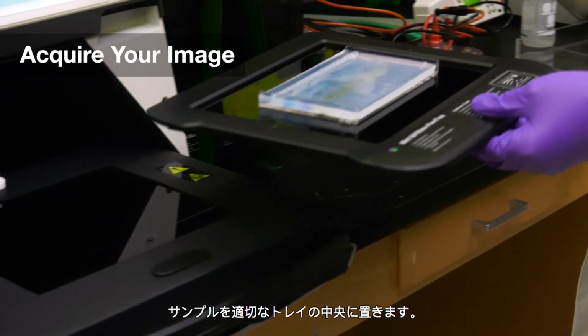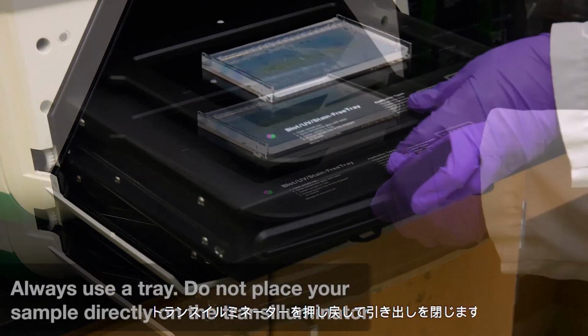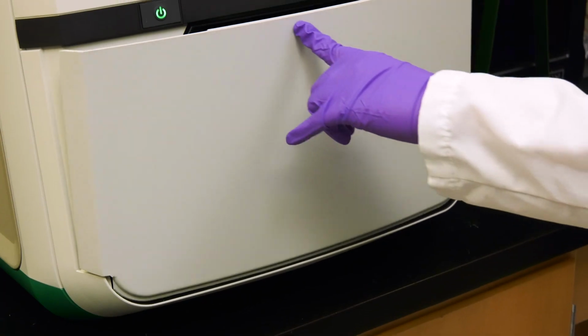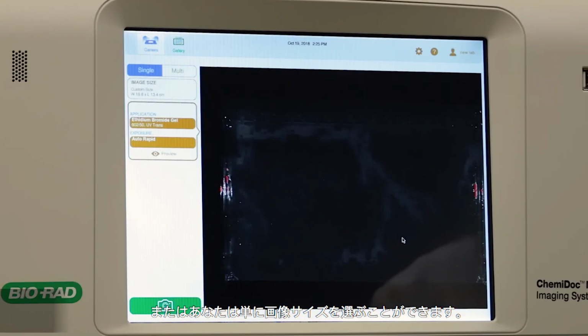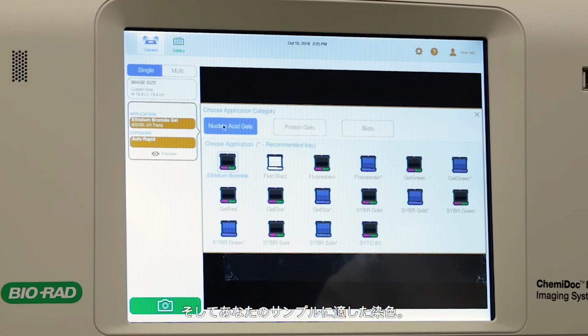Center your sample on the appropriate tray. Once you are satisfied with the position, push the transilluminator back in and close the drawer. Zoom into the desired imaging area, or you can simply select Image Size. Tap Application to select the category and stain appropriate for your sample.